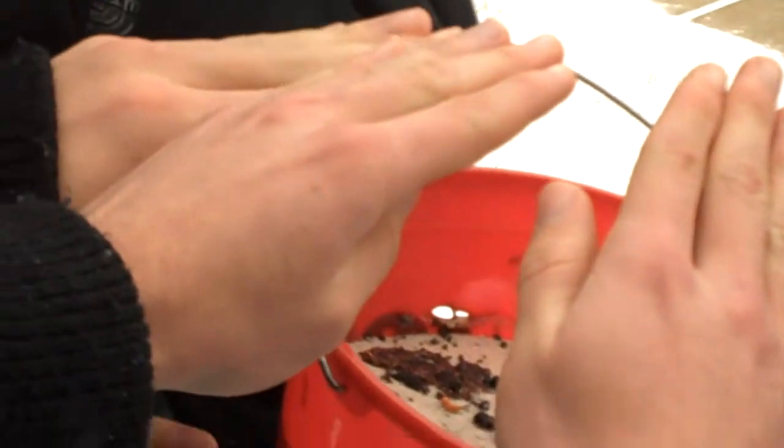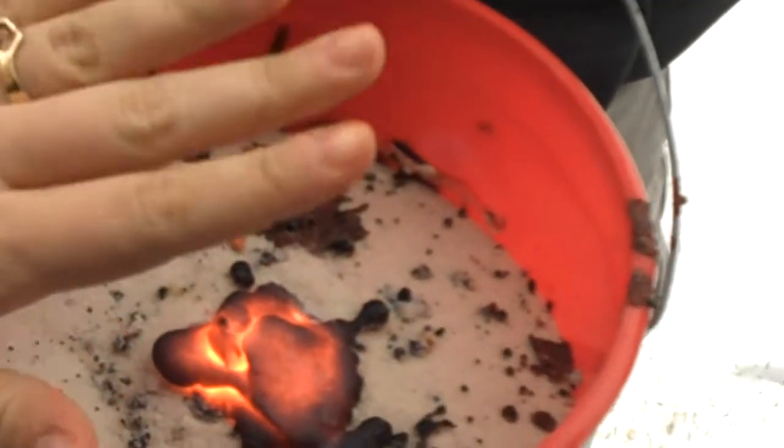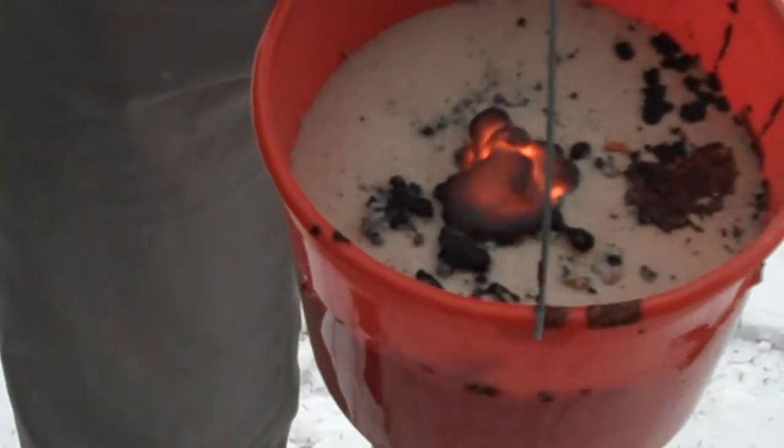I have plastic on me. Now, all you're feeling right now, because it's so cold out, you're mainly feeling that radiation — that radiant heat. Feel that? Because this is about 2,500 degrees Fahrenheit.